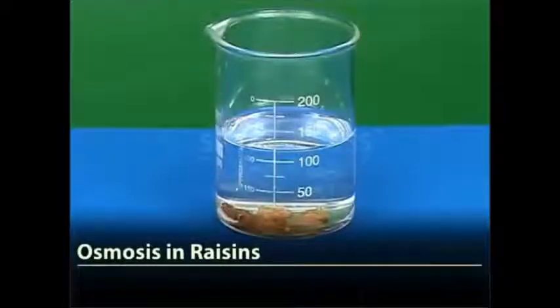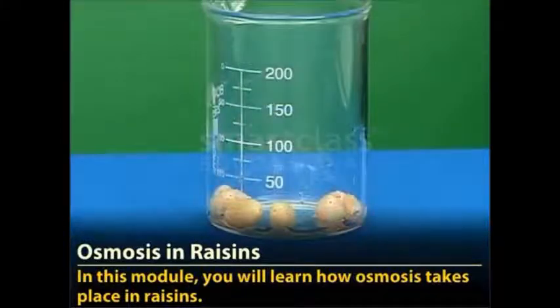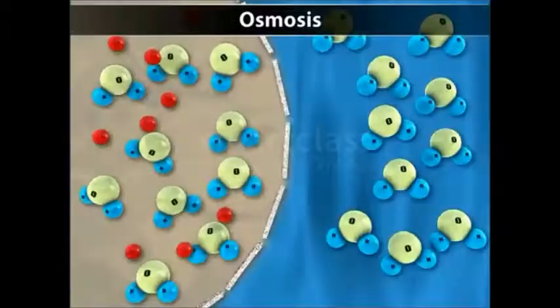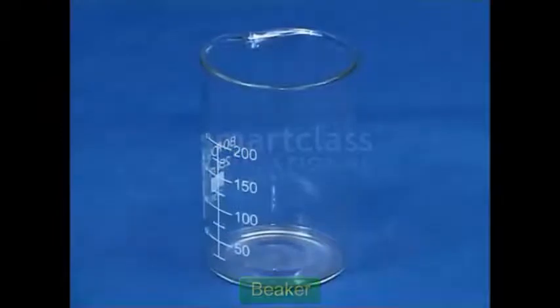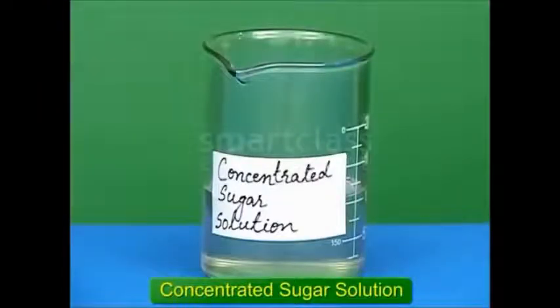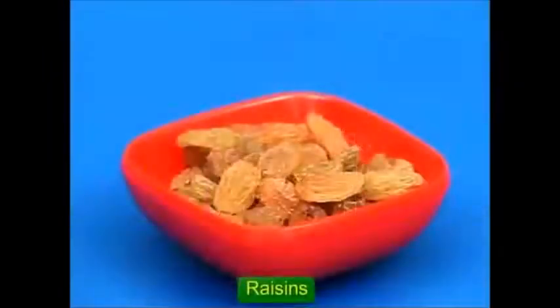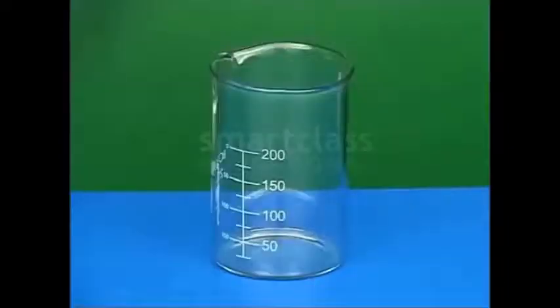Osmosis in raisins. In this module, you will learn how osmosis takes place in raisins. The materials that are required for this activity are a beaker, water, concentrated sugar solution, and raisins. Let us begin the activity.